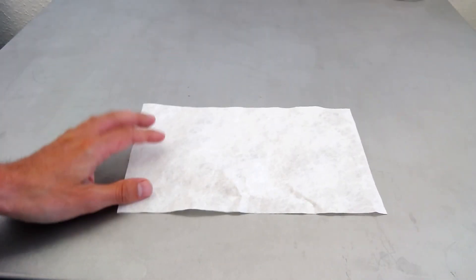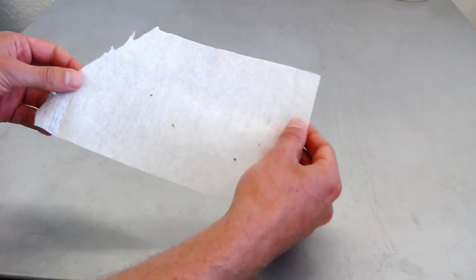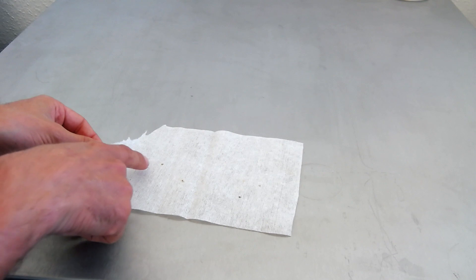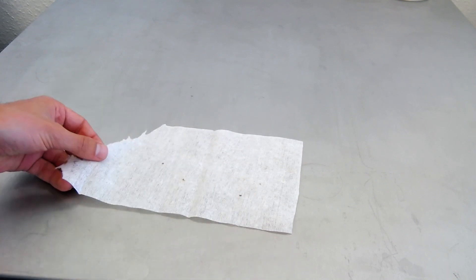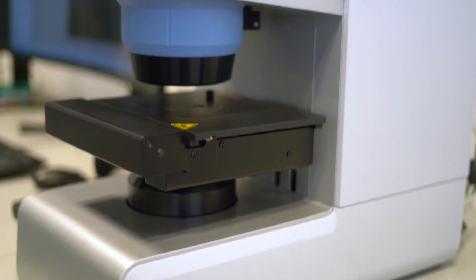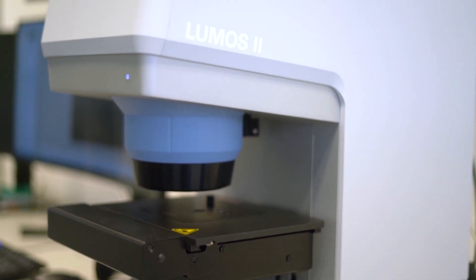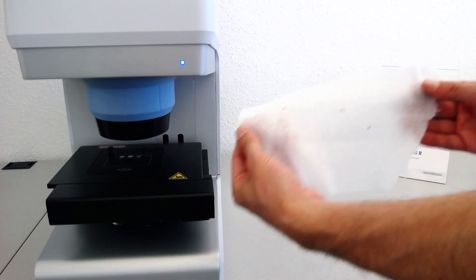We've got two pieces of fleece. This one looks great and it complies with the manufacturing parameters and quality requirements. But this one — not so much. We've got these stains in the fabric and we don't know what caused them. We're going to solve this mystery by using the Lumos II FTIR microscope to do some failure analysis and uncover the identity of these contaminants.